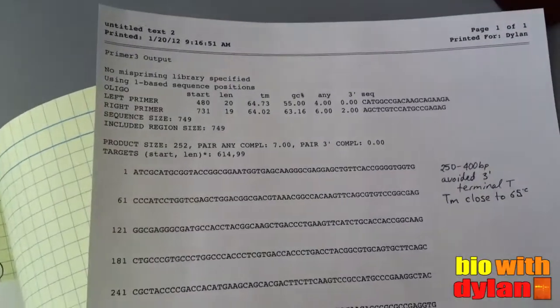So I'm here in lab designing new primers that will work slightly differently. Going back to the reverse transcriptase reaction from which we make cDNA from mRNA — reverse transcriptase starts at the 3' end and works backward to make the complementary DNA, but it can fall off the molecule and not quite make the complete double-stranded molecule. This means the primers I'm making should amplify a very small region of DNA, and they should aim for the 3' end of that molecule because that's where the reverse transcriptase is starting.